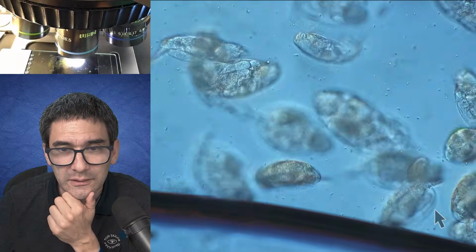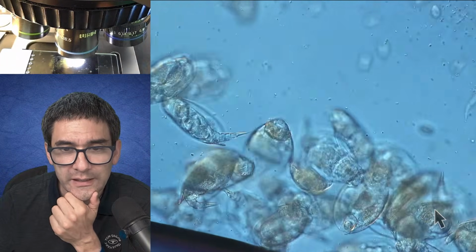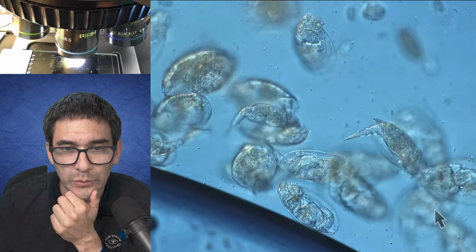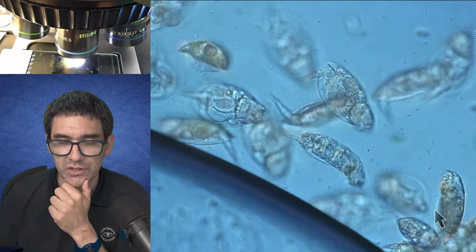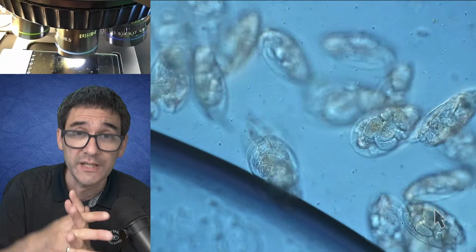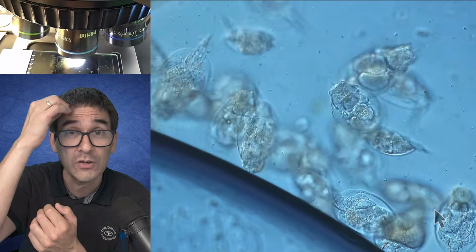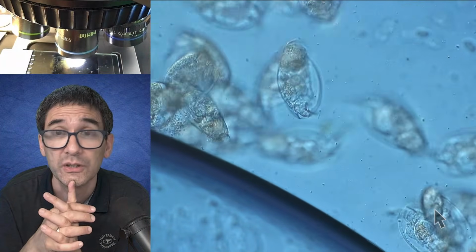I have actually read on Reddit today a new slide preparation technique that I would like to experiment with. Somebody posted a nice image on Reddit in the microscopy subreddit showing how to make cross sections of hair and fibers to make them visible. That's also something I would like to try.